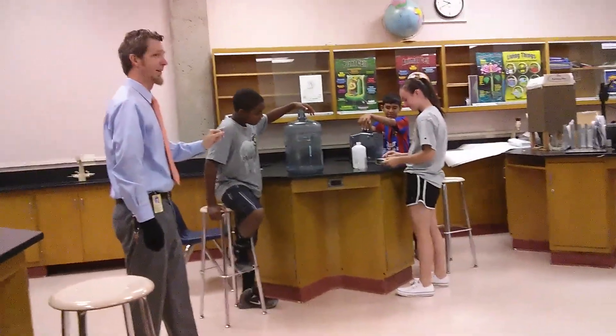Combustion! Ready, steady, go. Oh, God! Oh, my God! That was sick! So, Trey, is there anything you would have done differently about that? Why stand so close? We learned something — okay, so when you take your hand off, we're going to step back a step or two, a couple steps.